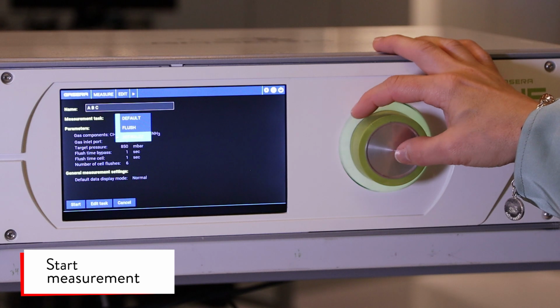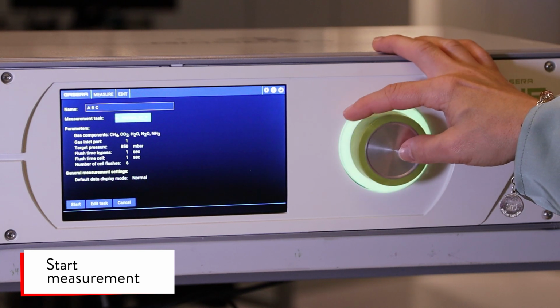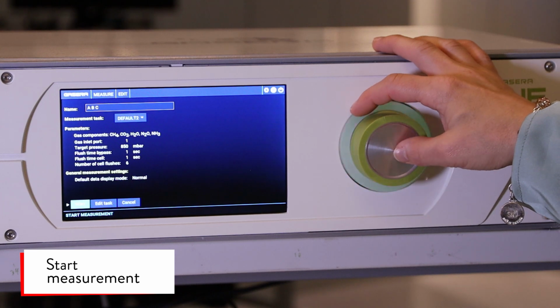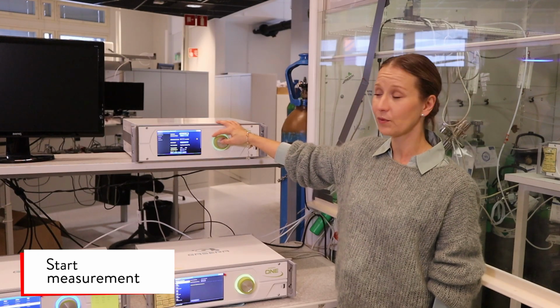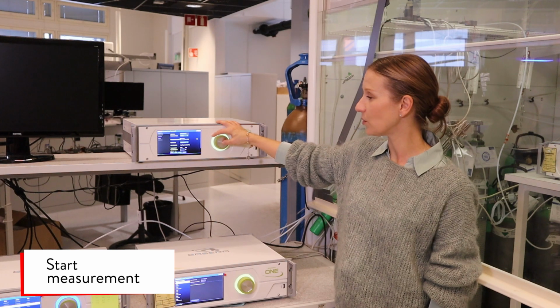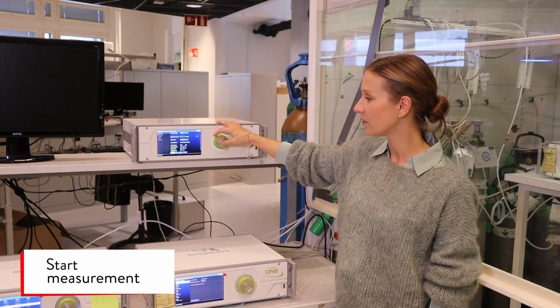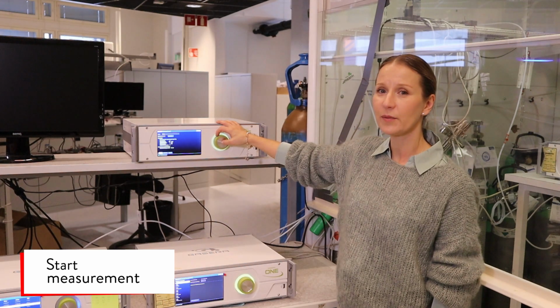We can use default 2, which has all the GHG gases, and we can check from the edit tasks that there's all the components we wanted to measure. Everything seems to be in order, and we can start a measurement.